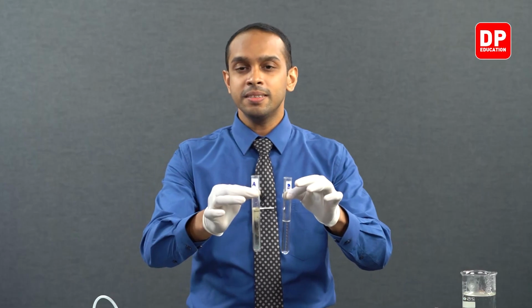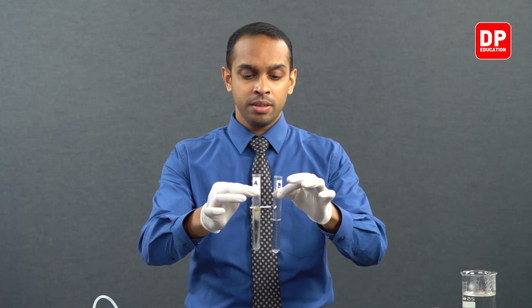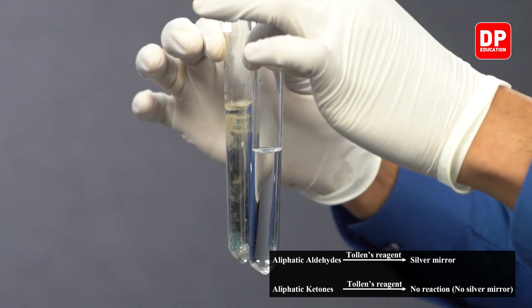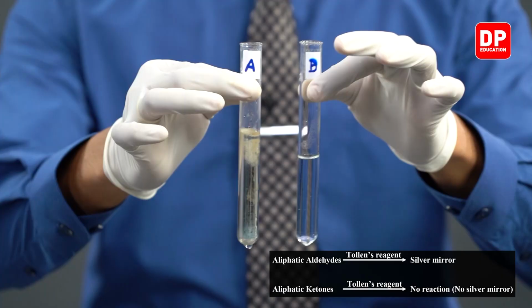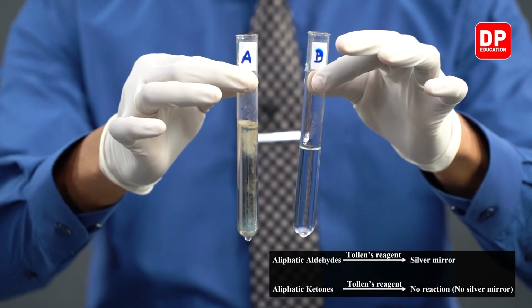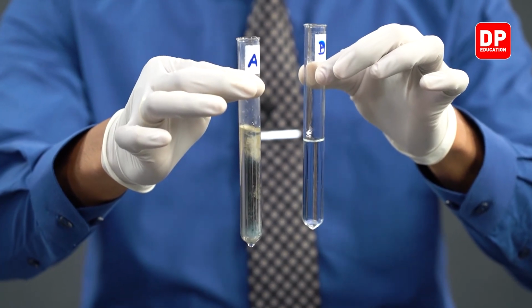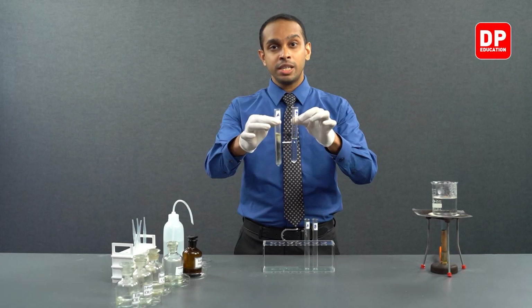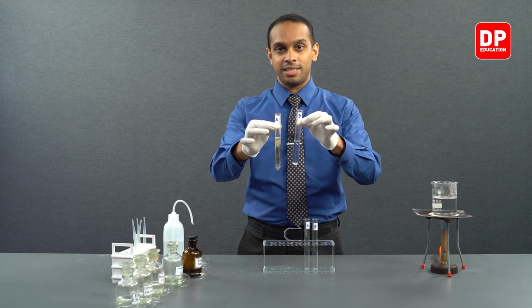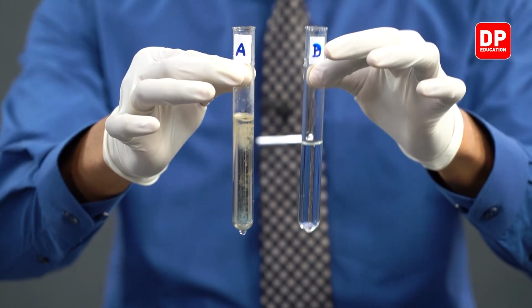You can see here the test tube A. The test tube A has formed a silver mirror, but the contents in test tube B have not formed a silver mirror. The contents in test tube B have not formed a silver mirror because we had a ketone in there. Ketones do not answer to our Tollens reagent test. So let me show you the silver mirror that is formed very clearly.